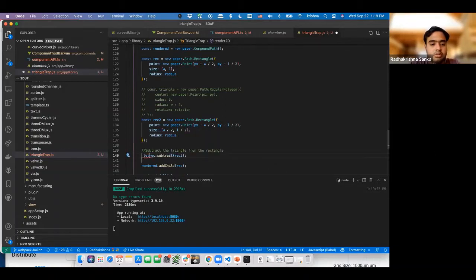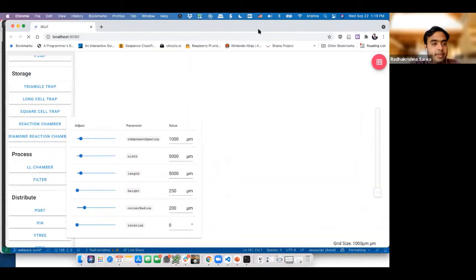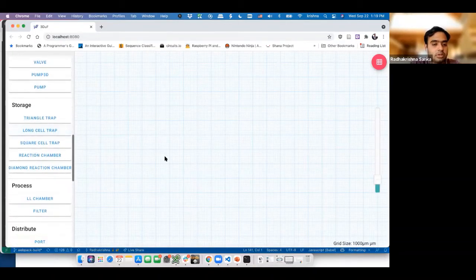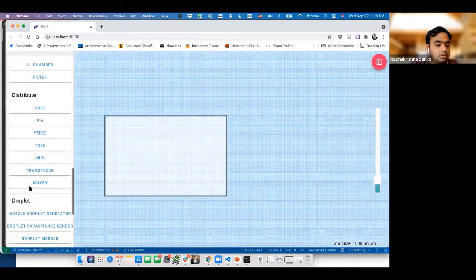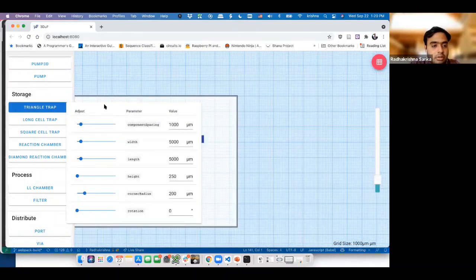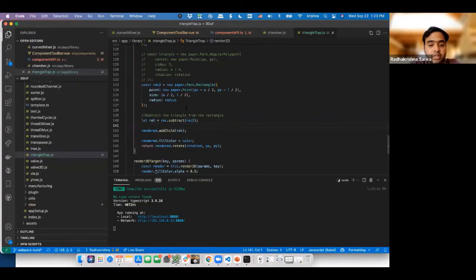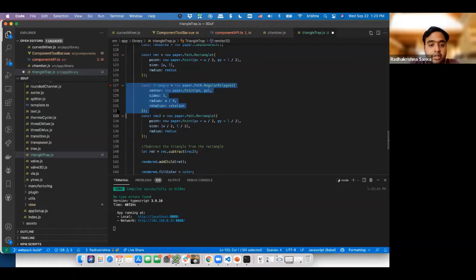So if I do this, I think it'll just work. Let's see. Trap. There you go. It basically cut it off over here because it used the origin as a top left corner. But the reason why it didn't work earlier was because we didn't set it up correctly. So now let's say I had triangle over here and I said subtract triangle.